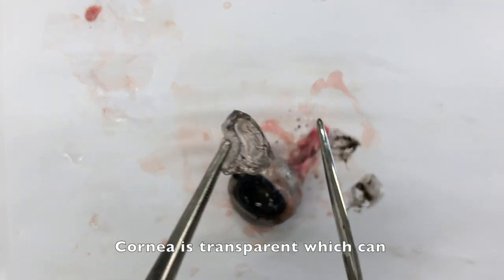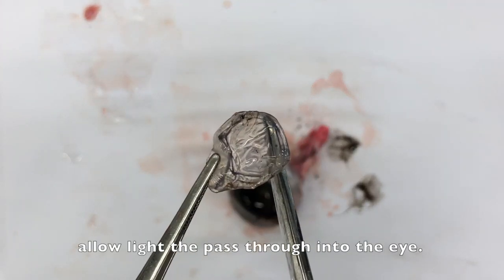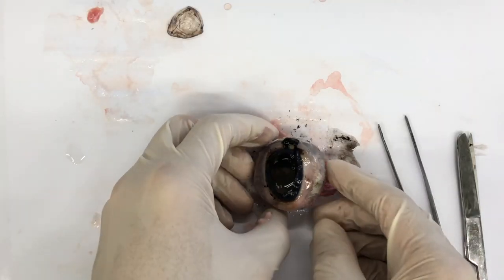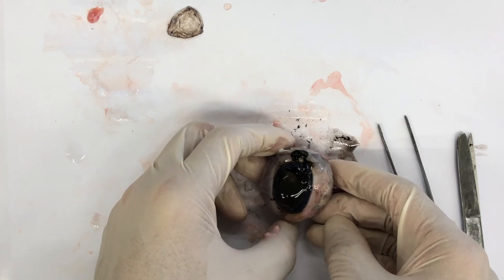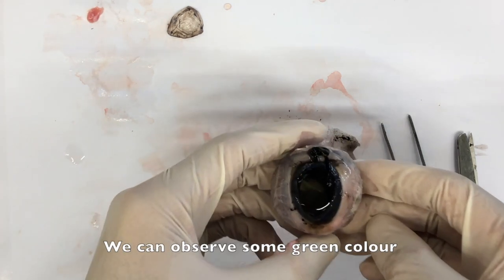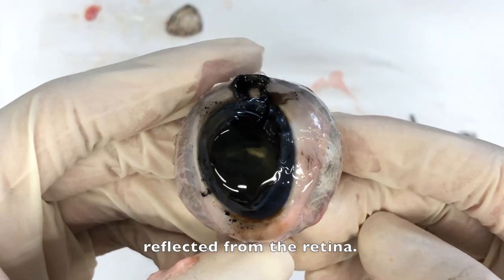And this is the cornea. It's quite transparent, which allows light to pass through into the eye. From here we can see some green color from the back of the eye, and it is the retina.